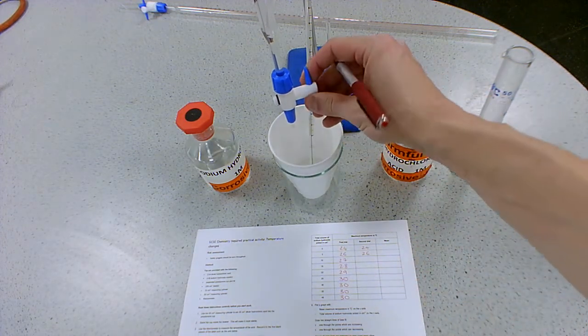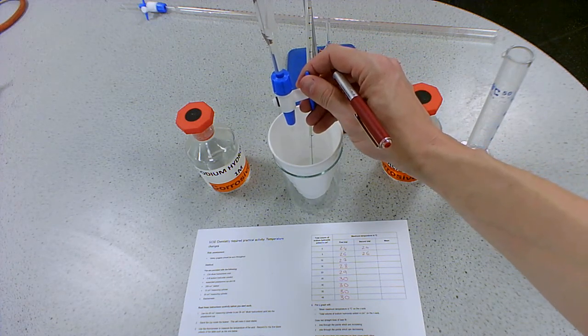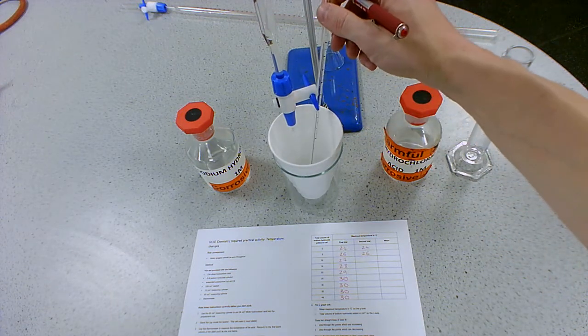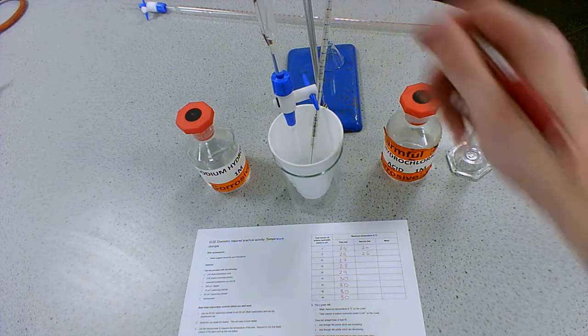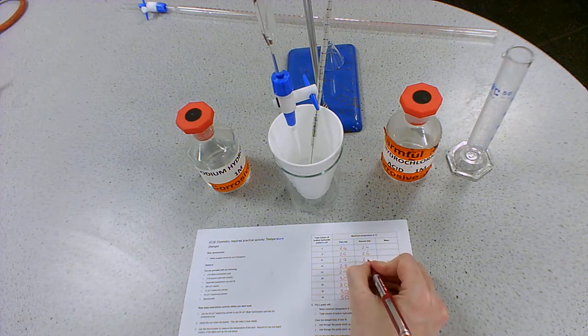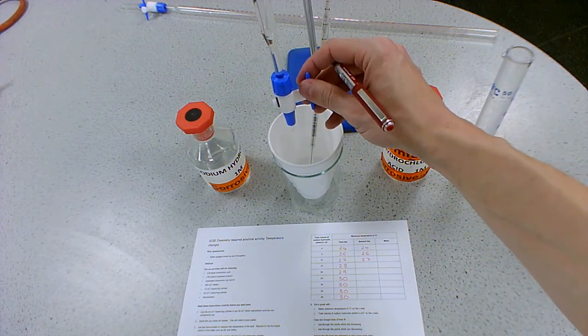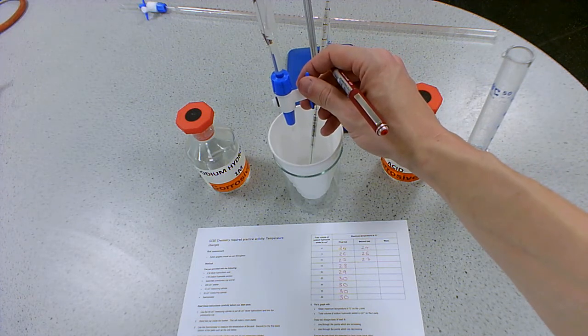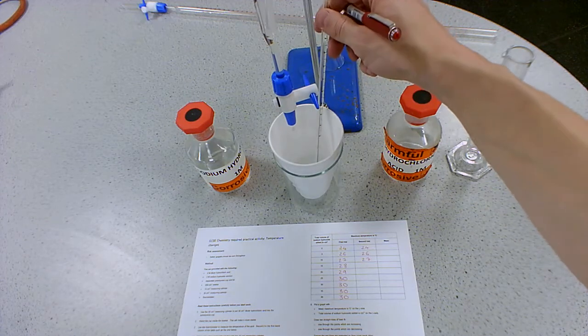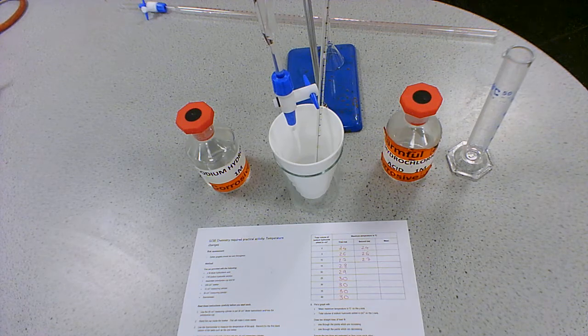So, now we add the next five. And close it, give it a quick stir. Wait a few seconds. And 27. Add another five. Twenty-eight.